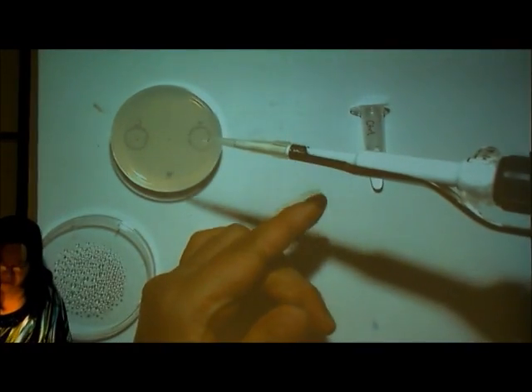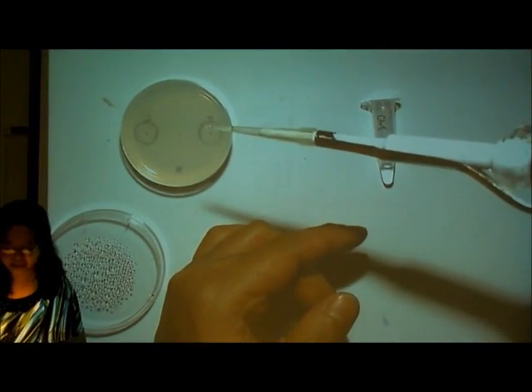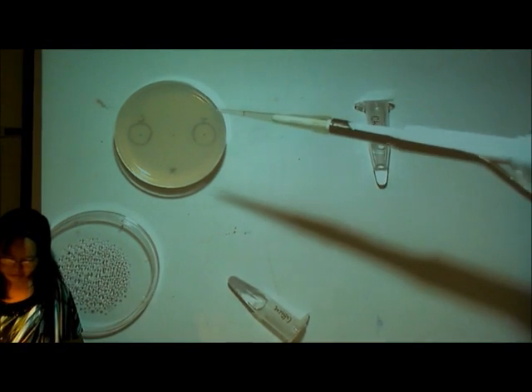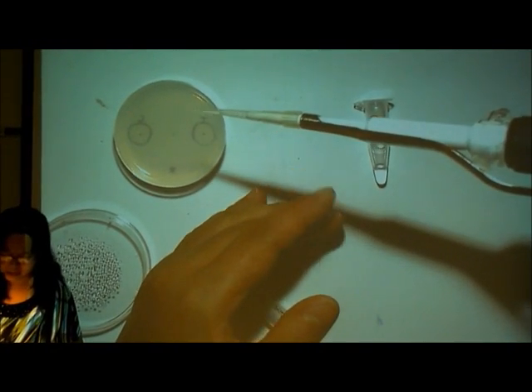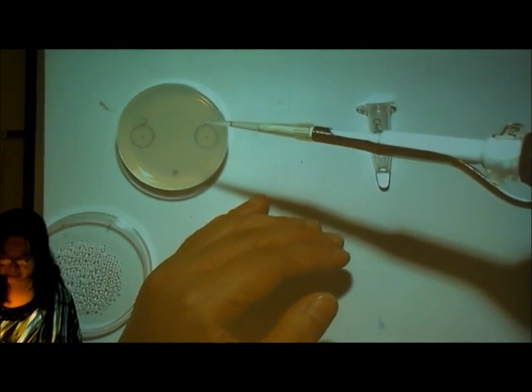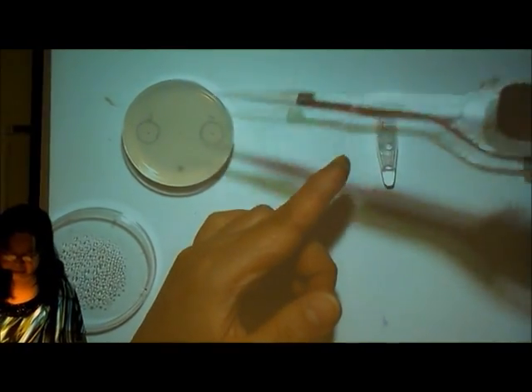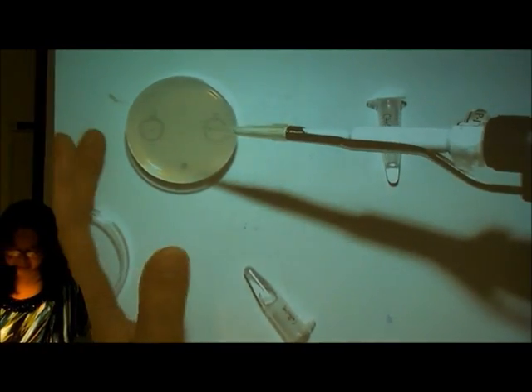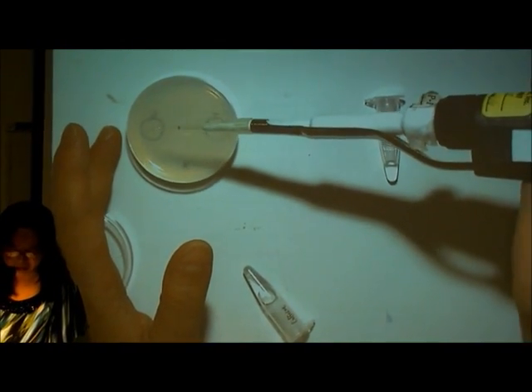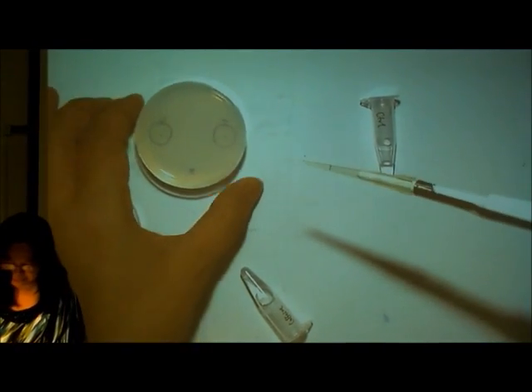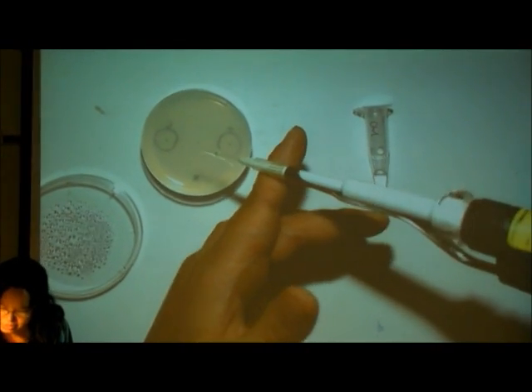So to have your tips steady, I have to support my pipette with my other hand like this. Otherwise you will shake and maybe you will make holes on your agar plate. So like this.